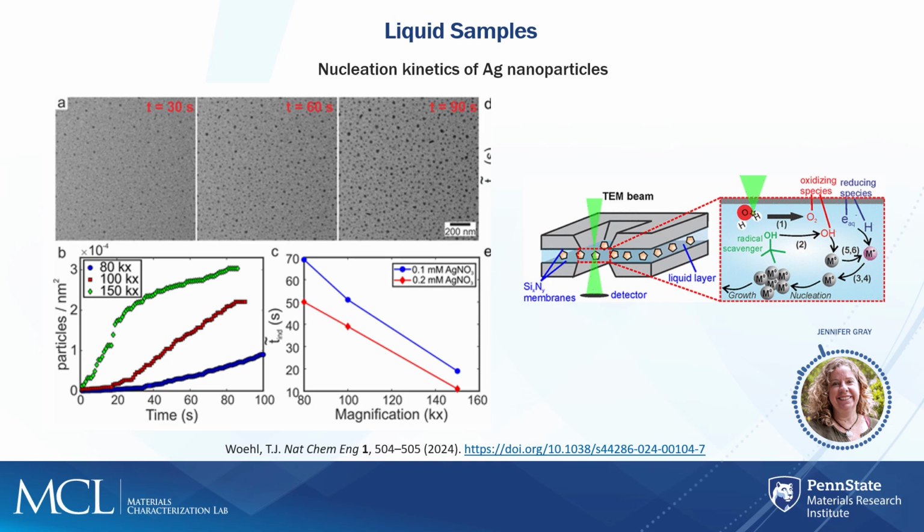One of these concerns would be, what does the beam do to the liquid? So this is work that was not done here. This was done by Taylor Woehl's group, but it nicely shows the effect of how the beam can interfere with what you're trying to see. So the beam can basically create all these kind of free radicals in the liquid. When it hits the water, it can dissociate the water molecules, causing all these charged species, which can then affect what you're trying to look at. So in this study, his group was looking at the nucleation kinetics of silver nanoparticles, and what they see is that as you change the dose, i.e., you go to higher magnifications, more dose, it's going to change the number of particles that are forming in a given amount of time under higher dose conditions. So you're accelerating the process of particle formation.